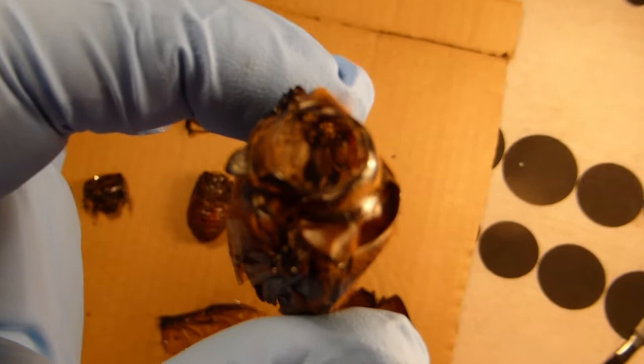If you look at the interior of this one, you can see it is actually almost hollow now and has dried very well.